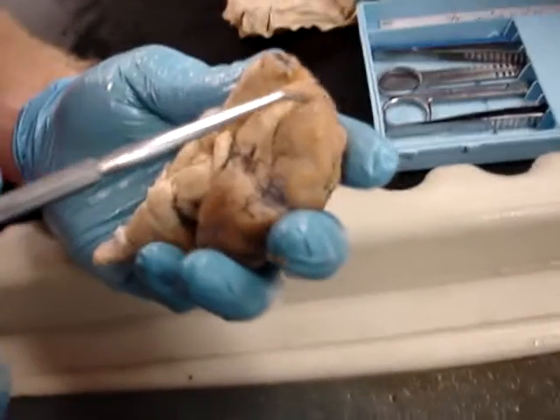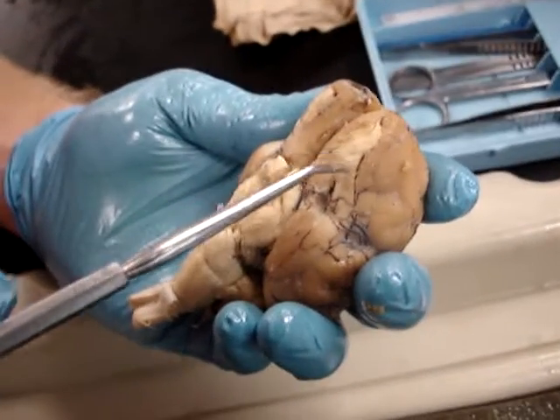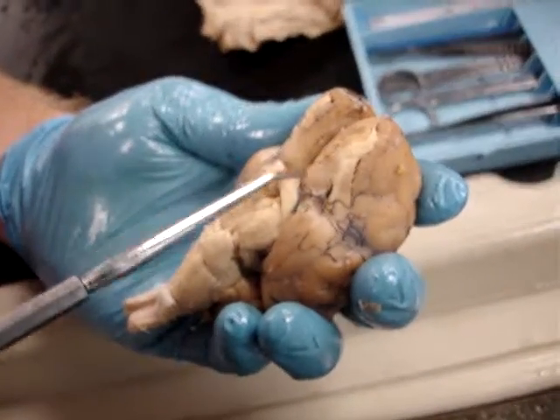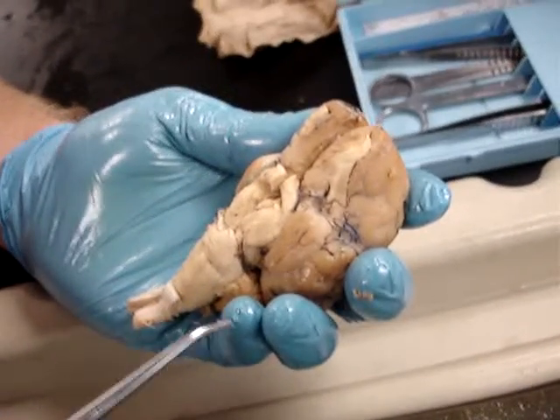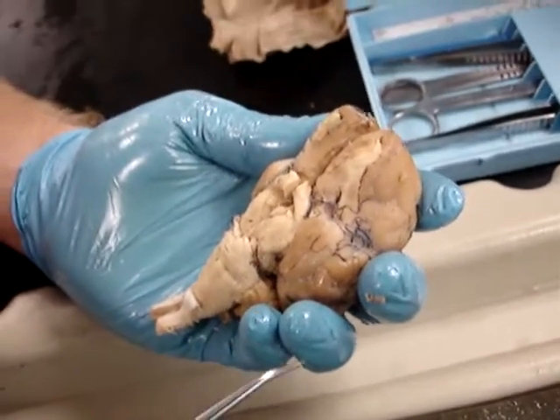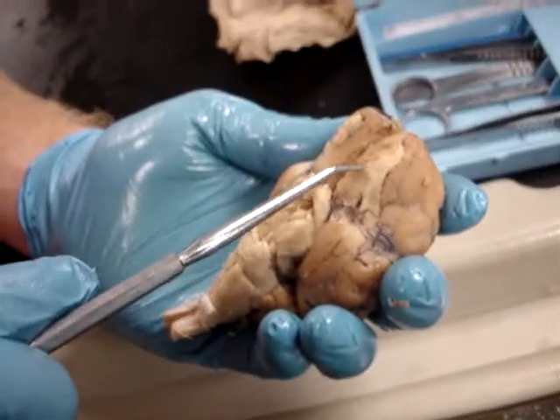This is the olfactory bulb, olfactory tracts, and then you have lateral and medial olfactory stria — so lateral and medial.